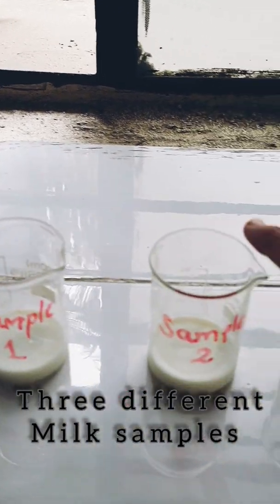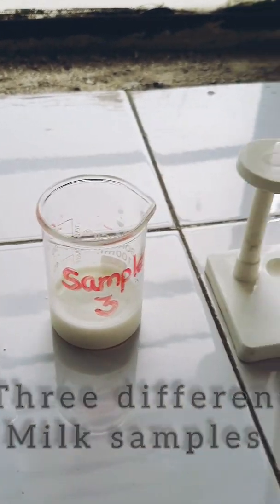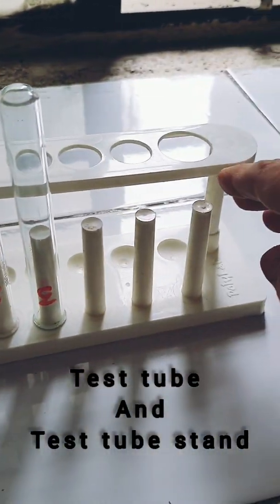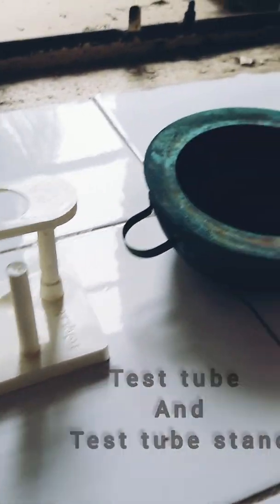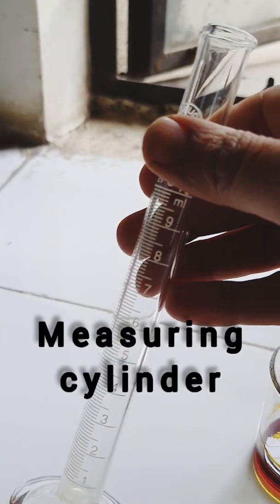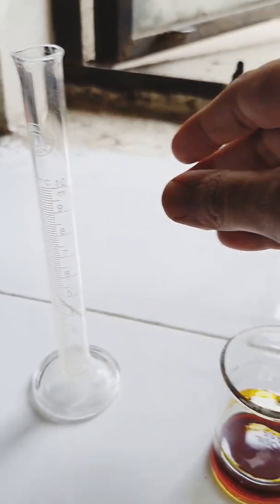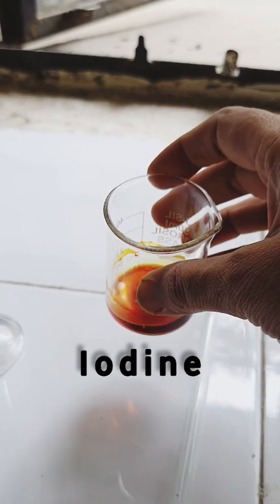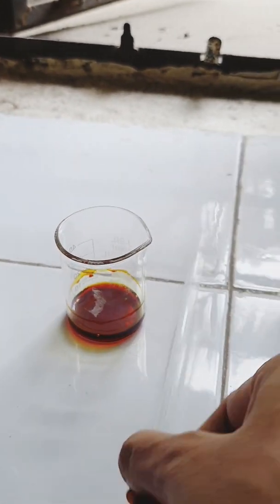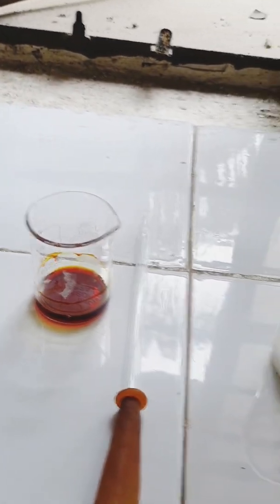For this, we require milk samples — 3 minimum samples preferred — test tube, water bath, measuring cylinder, iodine, and dropper.